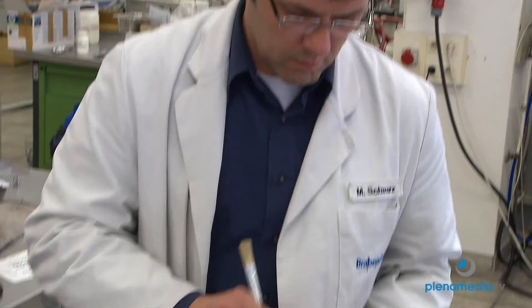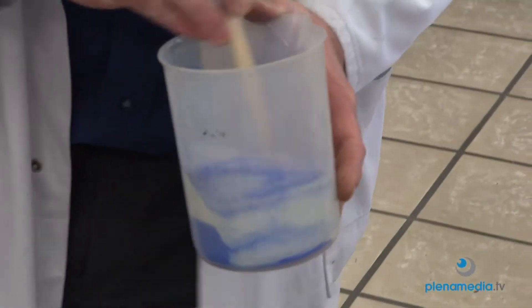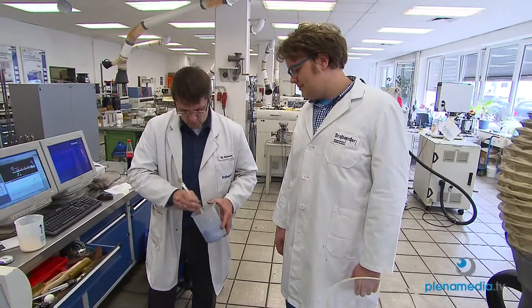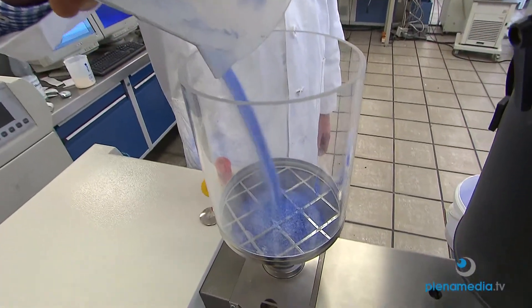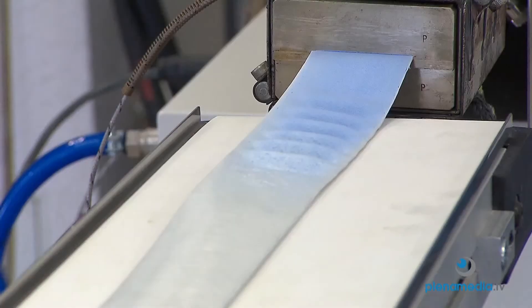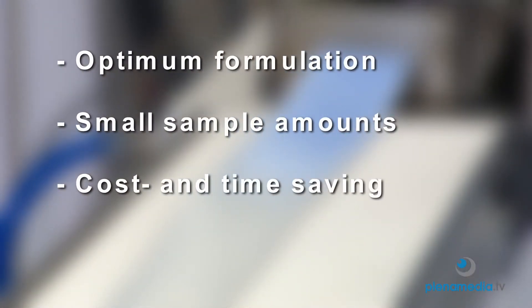Cost minimization is becoming increasingly important. Brabender testing devices stand for shorter development times, the development of optimized recipes, less material requirements, and therefore guaranteed cost and time savings.